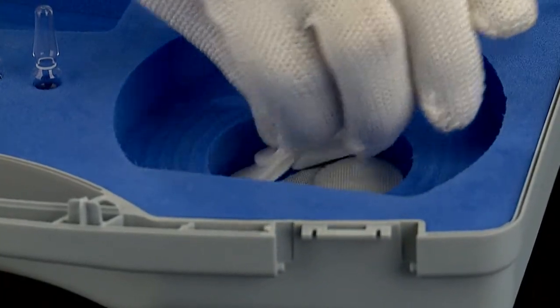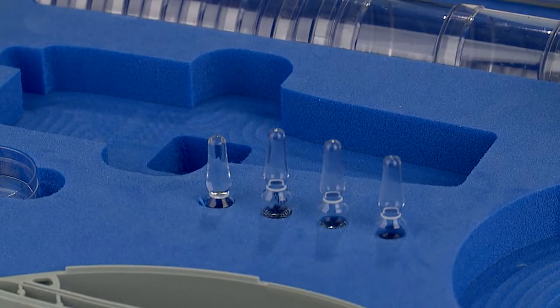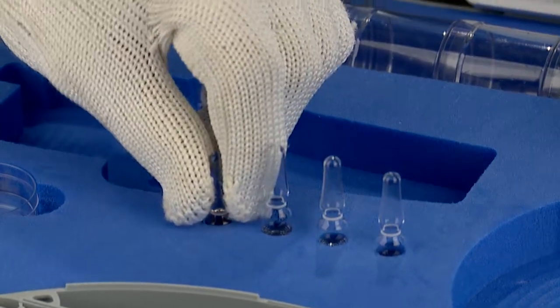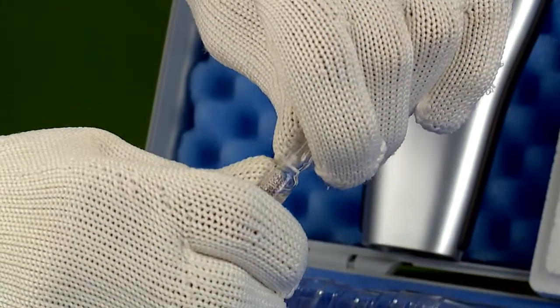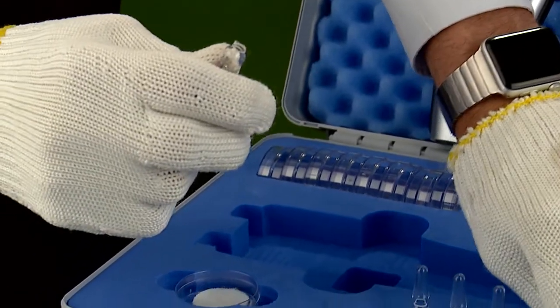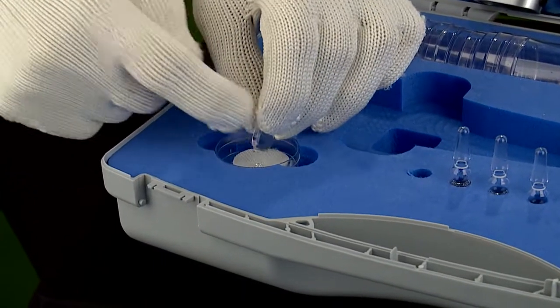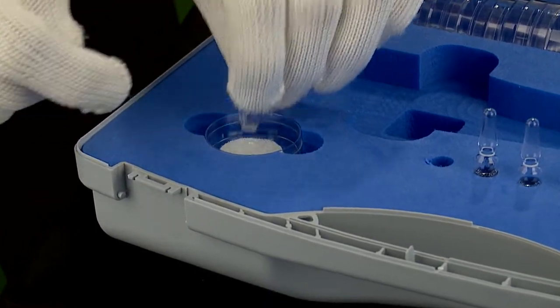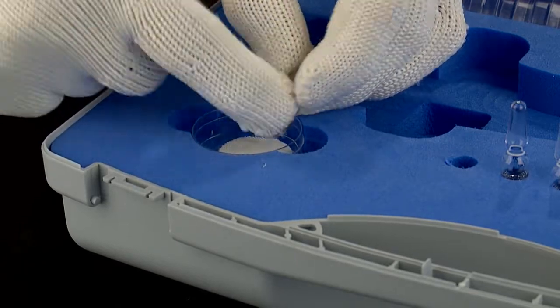To start the calibration, using a small sample cup, place one of the cloth discs into the sample cup, tap the top half of the vial to ensure all the liquid is in the bottom half of the vial, and then break open the calibration vial. It is important to note that the vial is glass — use safety gloves and safety glasses and break the vial open facing away from you. Empty all the liquid onto the cloth pad and dispose of the used vial properly.